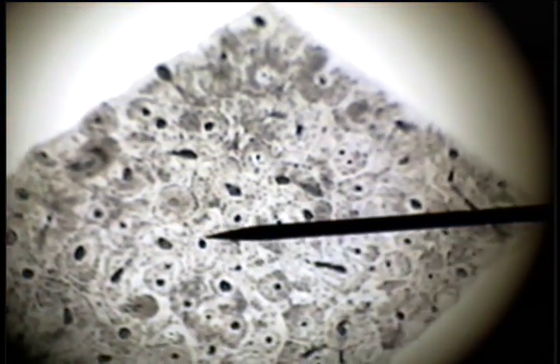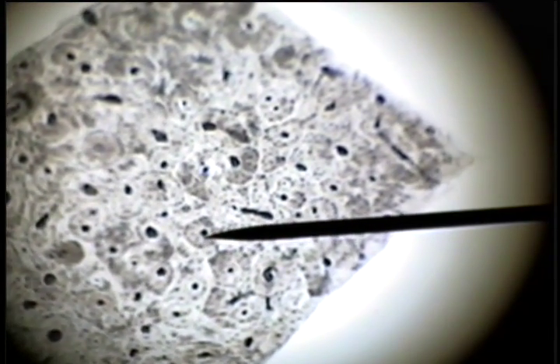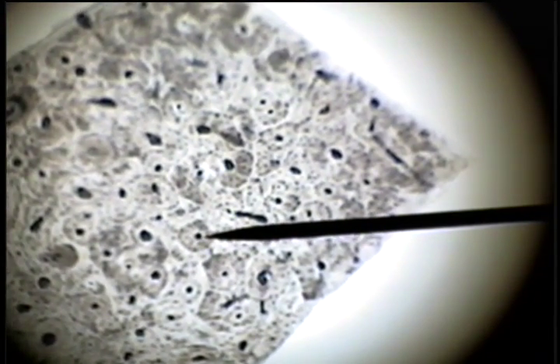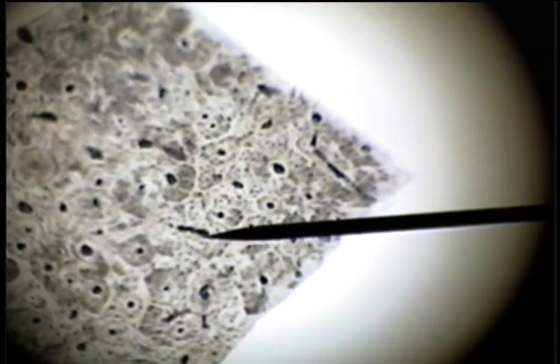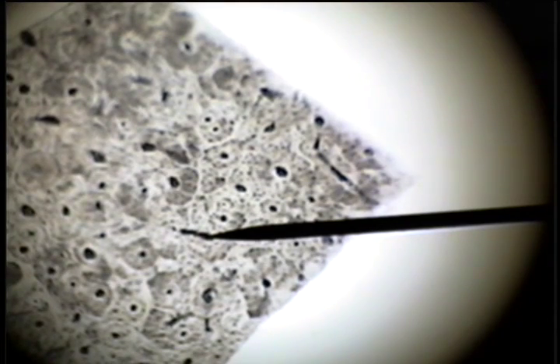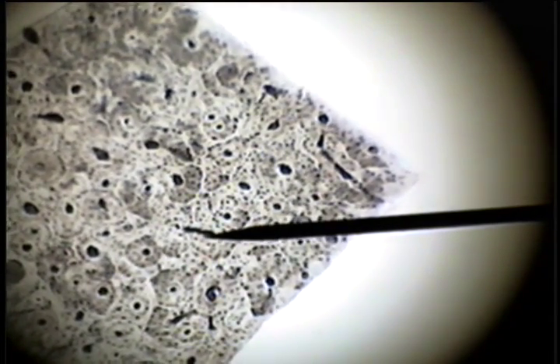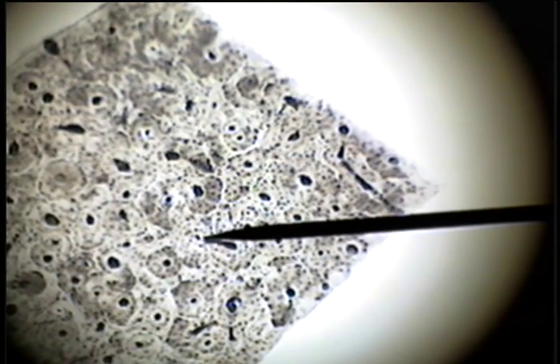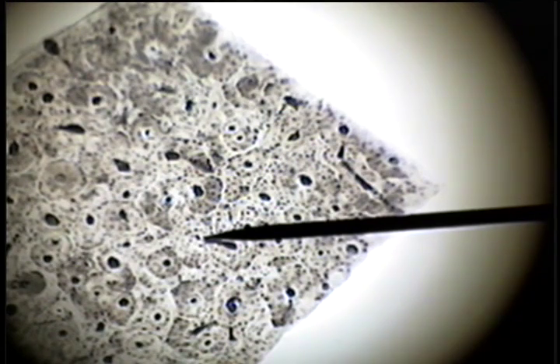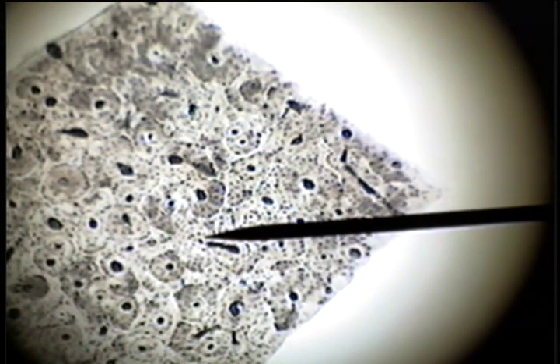This is ground bone again. The Haversian Canal may be connected with an adjacent Haversian Canal by the Volkmann's Canal. Here's Volkmann's Canal connecting this osteon unit with this osteon unit. These run transverse or perpendicular to the long axis of the bone tissue.